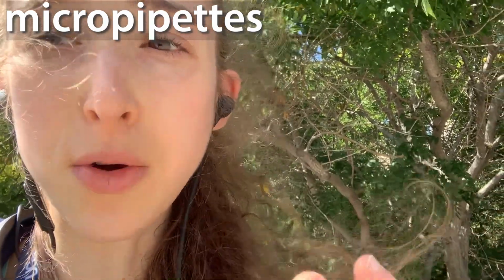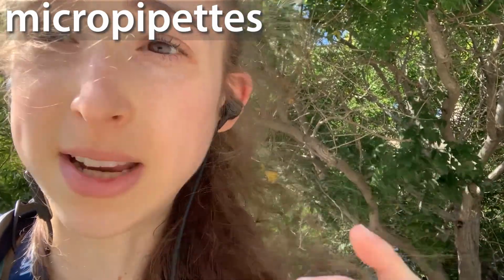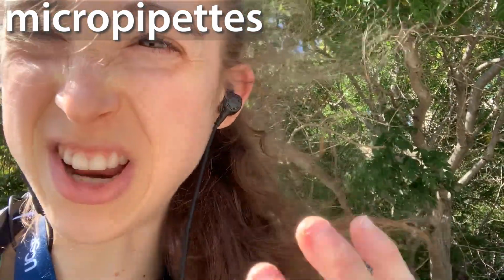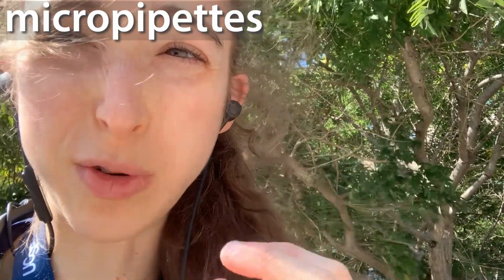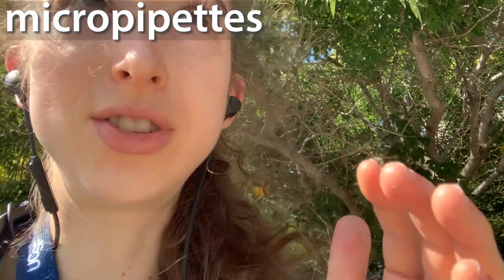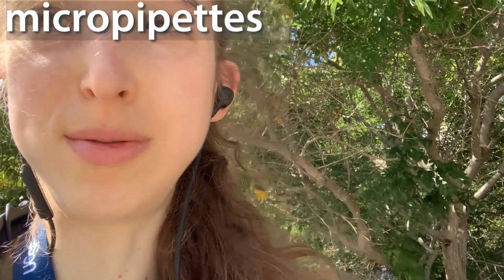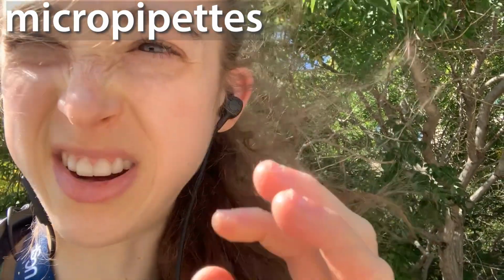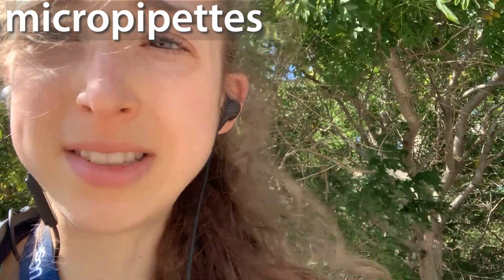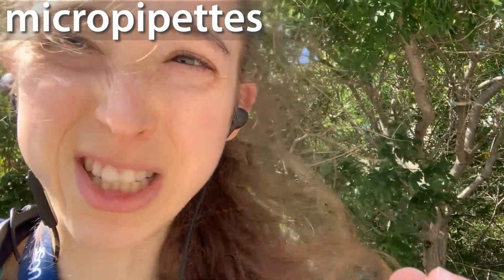Often that is okay. If you're using larger volumes, it's okay sometimes if it's not as accurate, if it's not as precise as when you're working with small volumes. When you're working with small volumes, the tiny little bit of difference is a large difference, ratio-wise. But if you are pipetting a large volume of something and you have a little less or a little more, that's really not that big of a deal. How precise you need to be is going to depend on the experiment and that sort of thing.